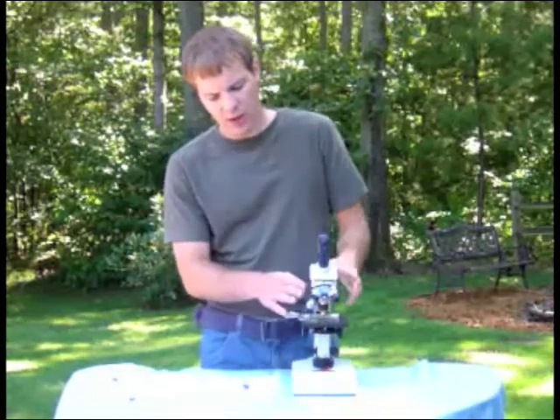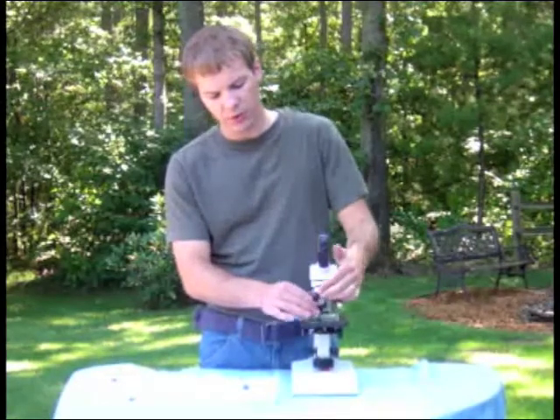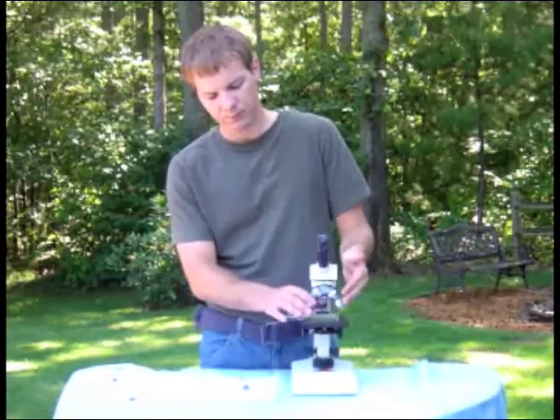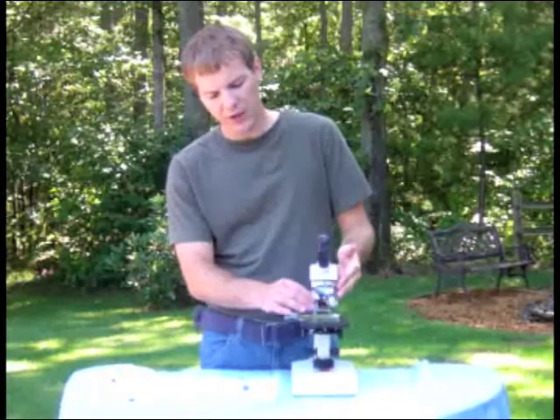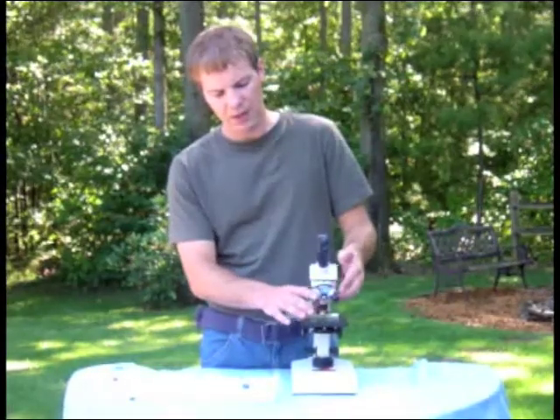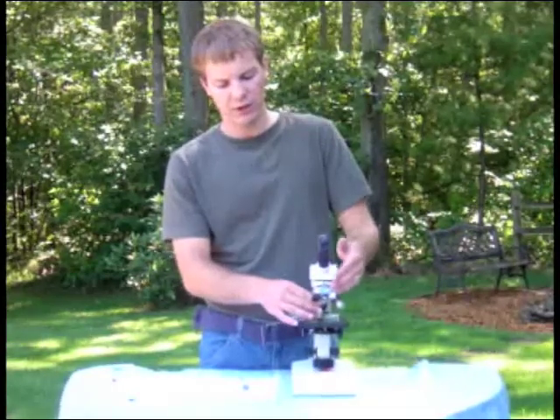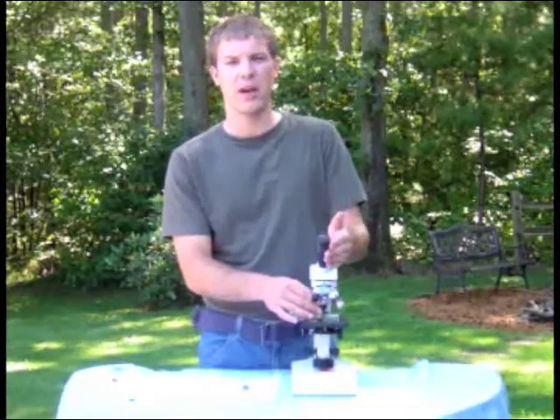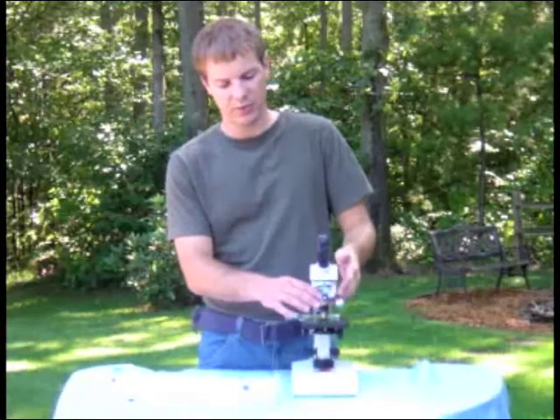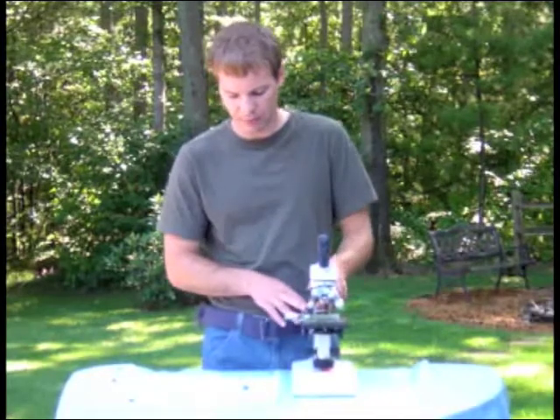The second thing is the objective lens. You have three of them and you can change between the three just by twisting, as you see here. You'll feel it click into place. A common mistake students make is they twist it but don't click it into place, which means when they look through the eyepiece, they don't see anything. So make sure it's clicked into place — you'll be using all three of these at some point this year.